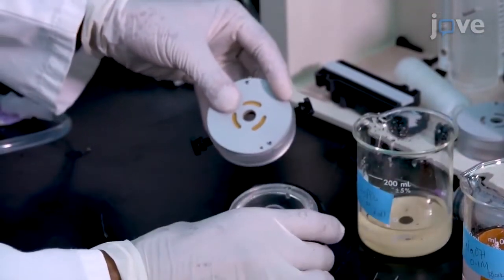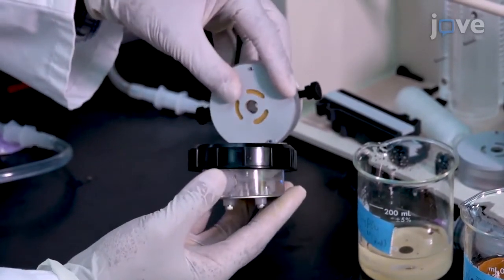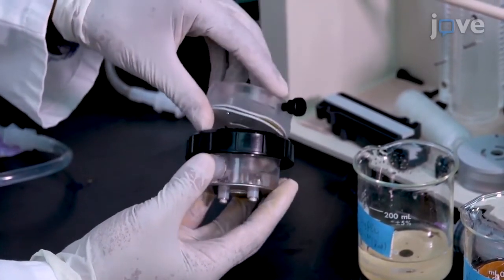Next, tighten the plastic screw holder to ensure a leak-free assembly. Cover the sample collection ports with sealing tape.